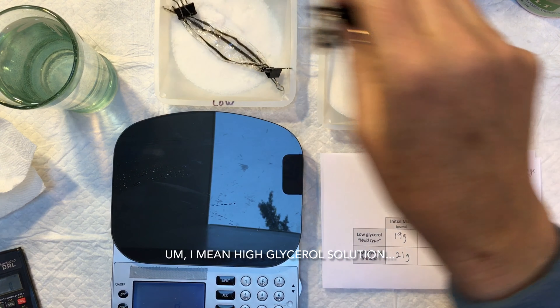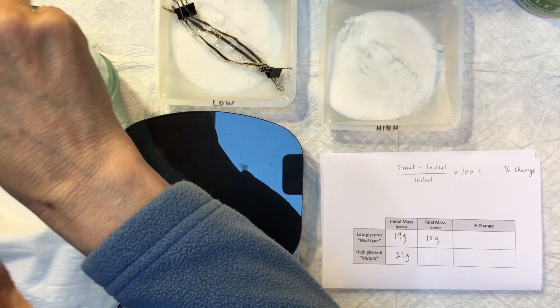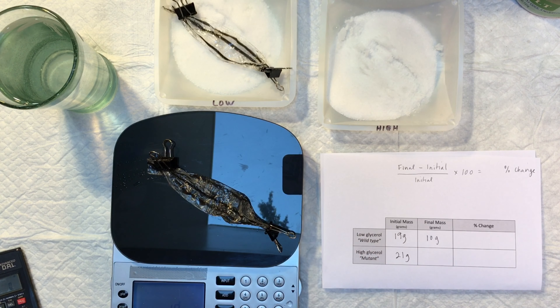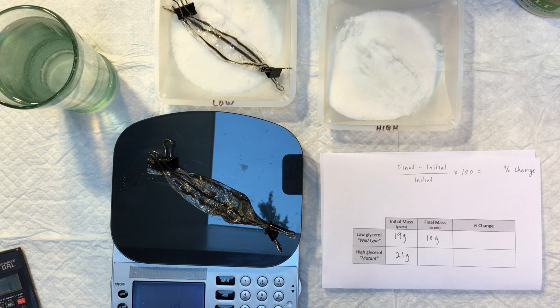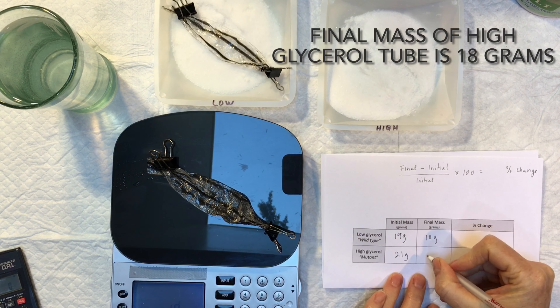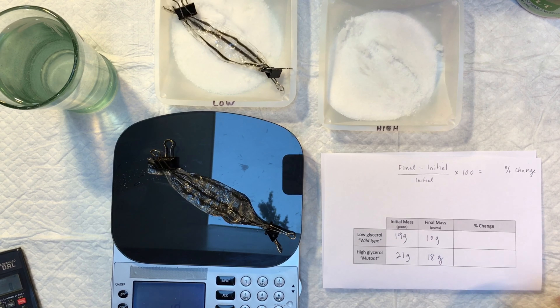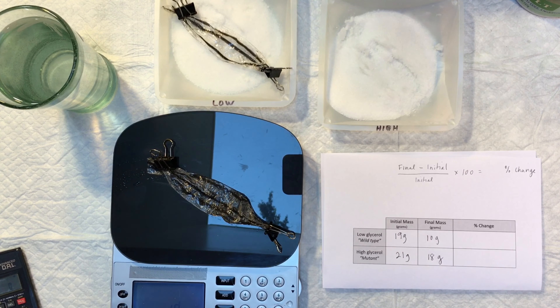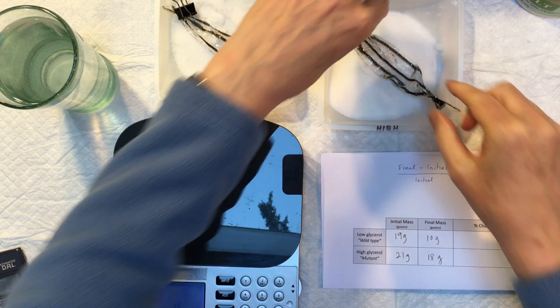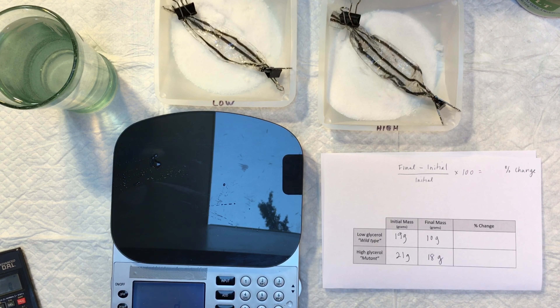Our high glycerol solution — again, get rid of the salt — and it weighs 18 grams. It still has quite a bit more liquid inside it and the salt is not quite as wet. The low glycerol tube also looks very thin and the salt around it has a lot of moisture on it.